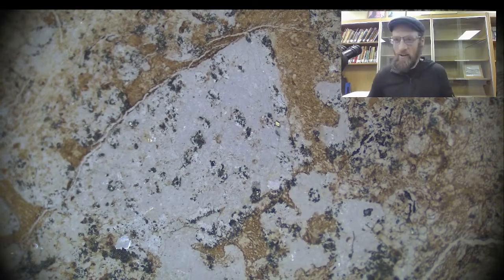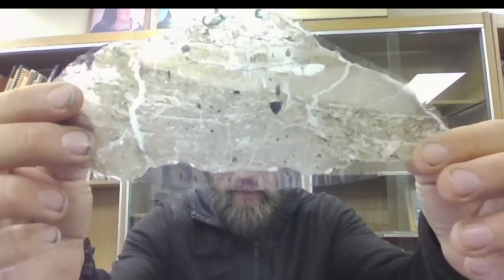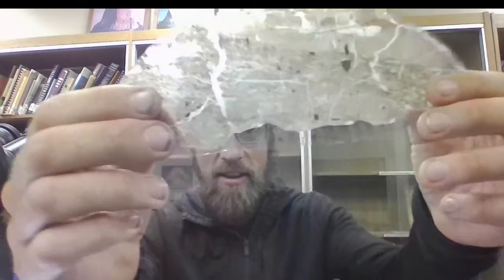All right, cool. To introduce a little bit, looking at coal ball fossils. Coal ball is not actually made of coal. It's fossilized peat that's been permineralized as calcite minerals. This is one of my professor's peels. A surface is polished and then a peel is taken.